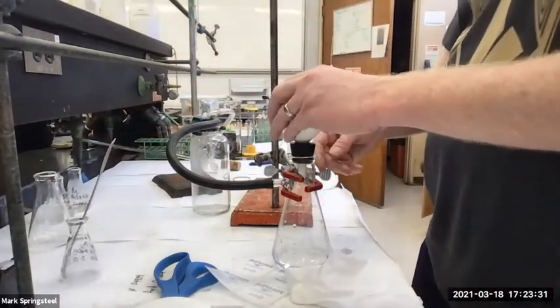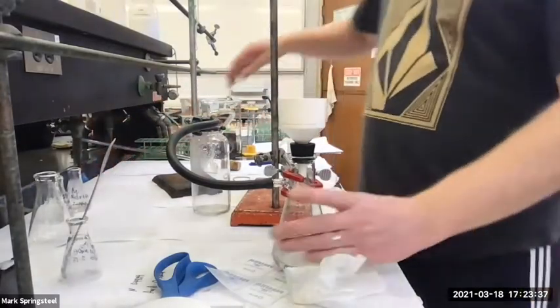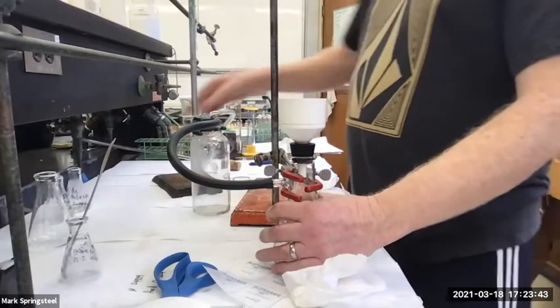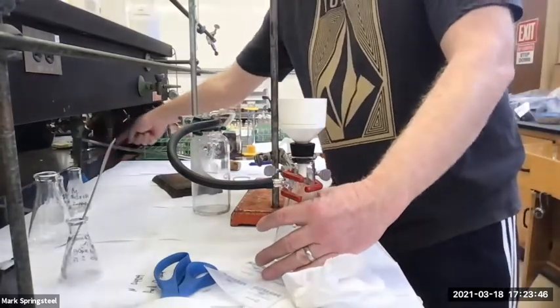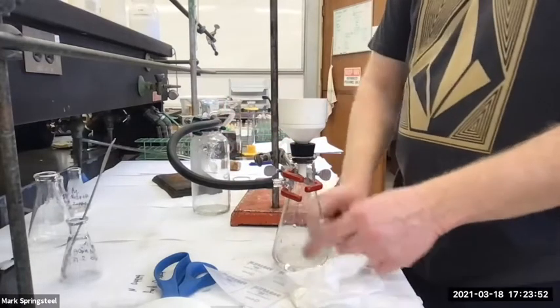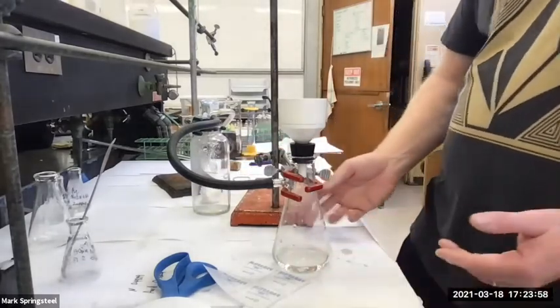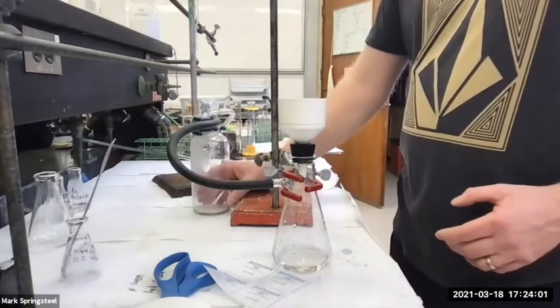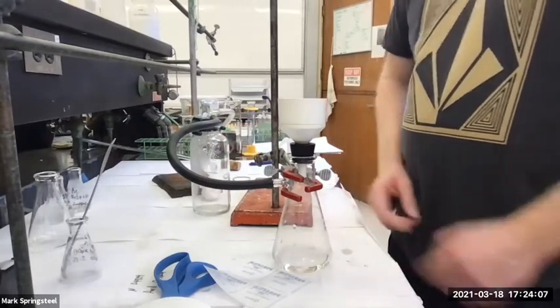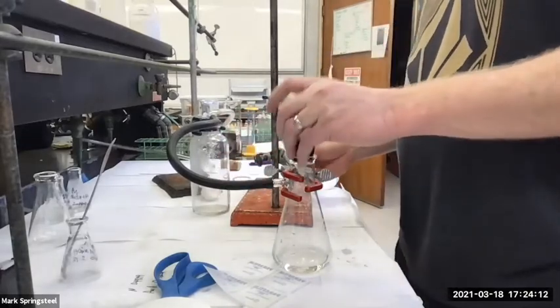If I kept this on and then turned off the aspirator, it's no longer sucking air this way. And there's a good vacuum setup inside of this filter flask, inside of the water trap bottle. Since there's a vacuum here and no longer a pull there, tap water can get pulled through our tube, start to fill up our water trap bottle, and then we can start to get tap water into here. And I don't want tap water in there because what if I wanted to get a second crop? So this water trap is like a fuse. It's got to fill all the way with tap water before it starts to fill this up. But if I'm breaking the vacuum, then I don't even have to deal with this.